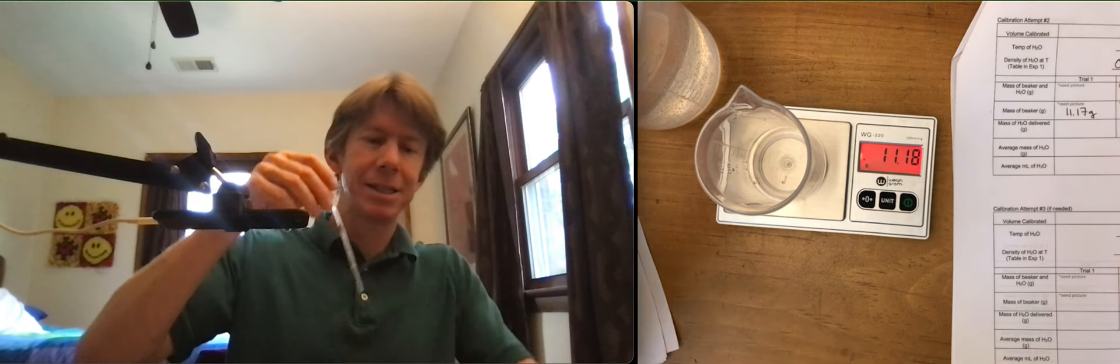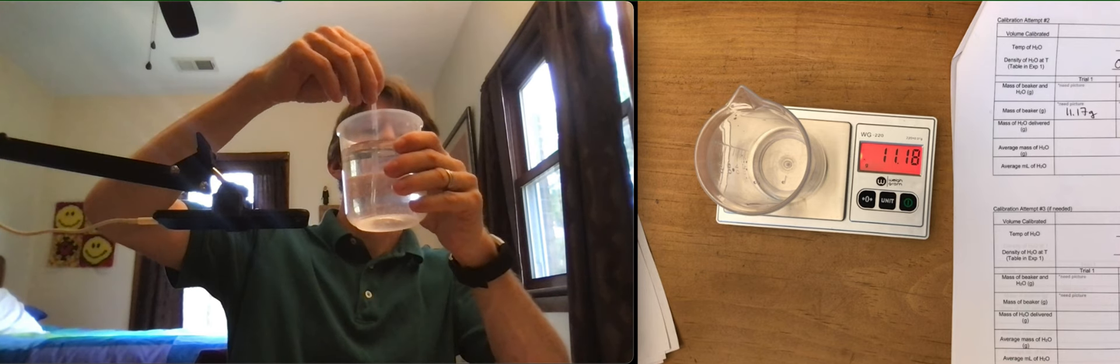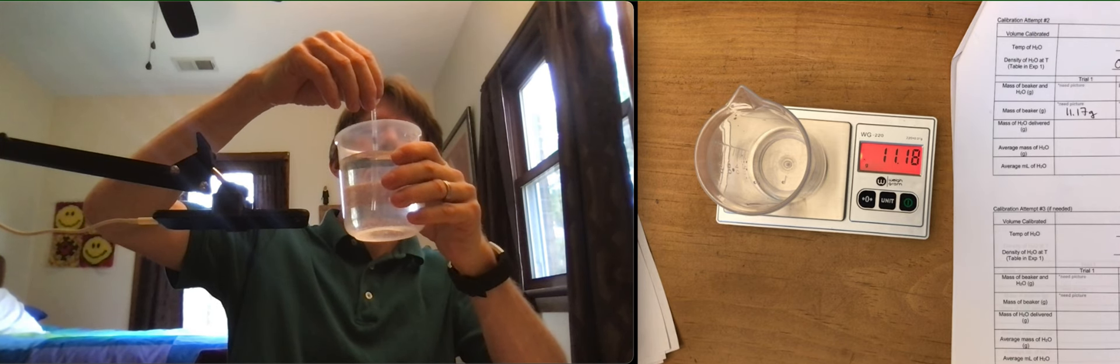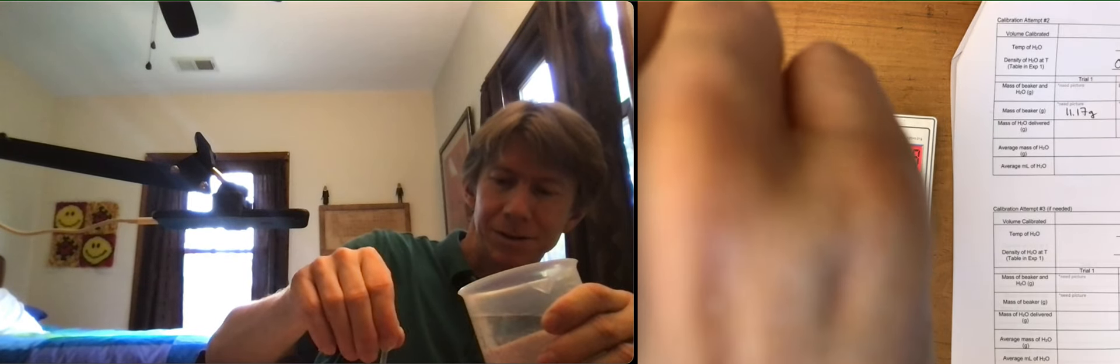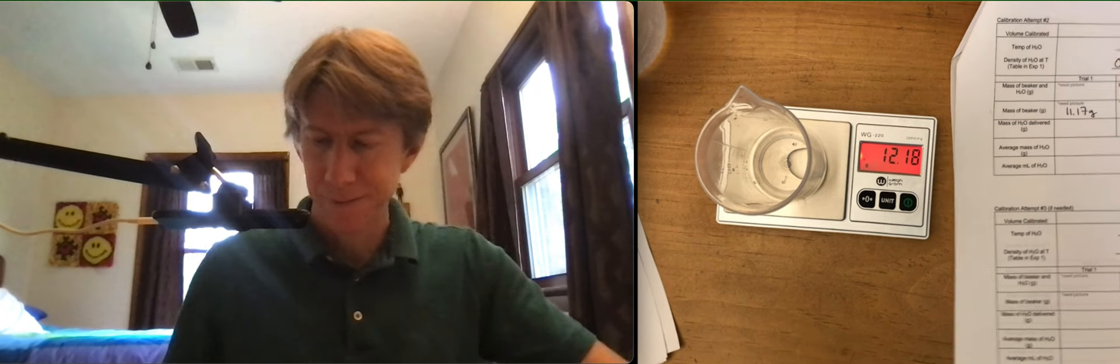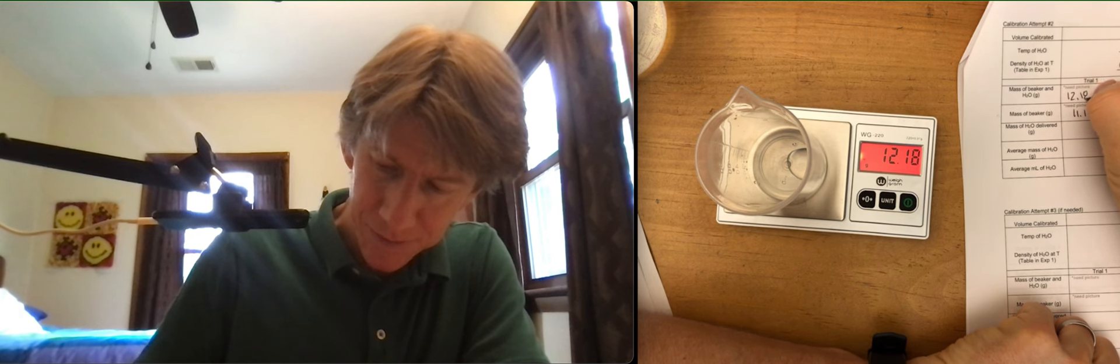Now I'm going to fill it up to the line this time, which is a little higher. All right. I'm going to, oh, I did it again. Now, 12.18 to 11.17 is 1.01 grams, which is within my 0.02. See how it comes out again.